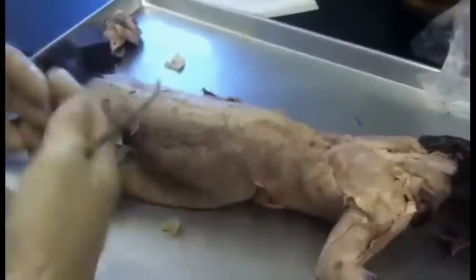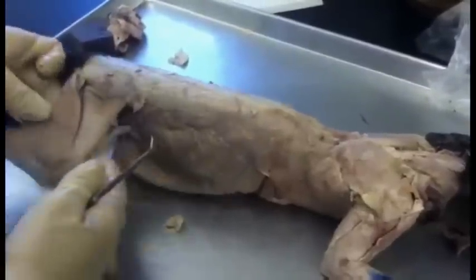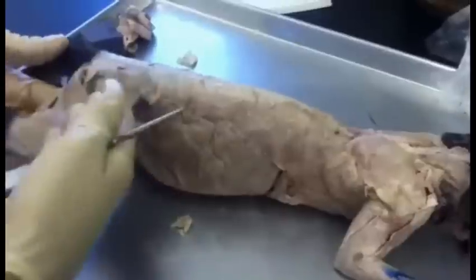This is the cat. We're going to go through the muscles of the cat. We're going to start with the superficial muscles, starting at the posterior end and moving forward, and then we're going to do the deep muscles on the other side.